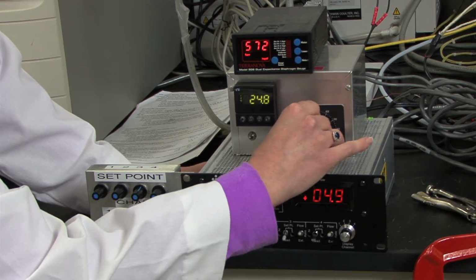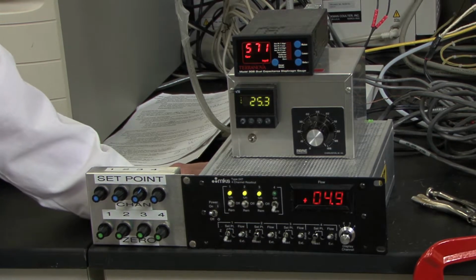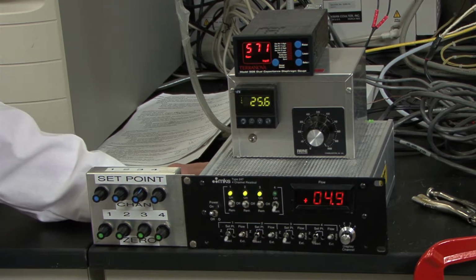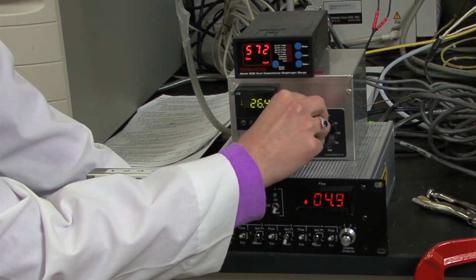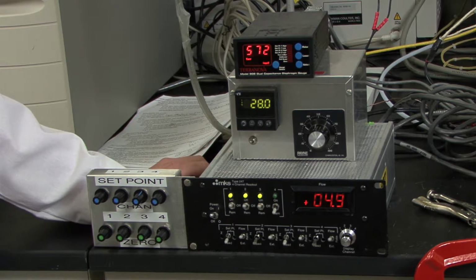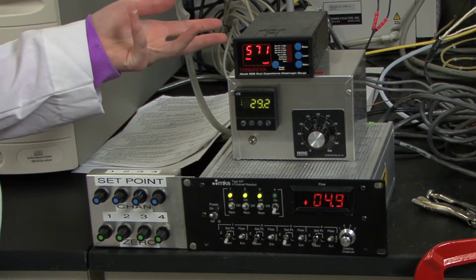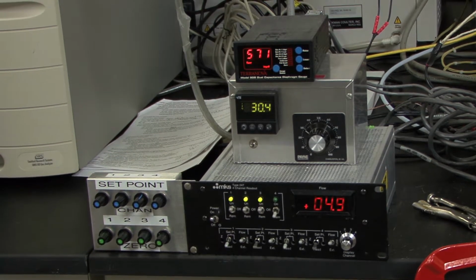And you can use this dial to give it more power. So I'd recommend going all the way to 100% power until you're about 30 degrees below the necessary temperature, at which point you would turn it down to 30%. Because if you leave it at 100, it will overshoot your temperature and it will be difficult to cool down. So you'll want to let the catalyst settle at your desired temperature and then start collecting a scan again.